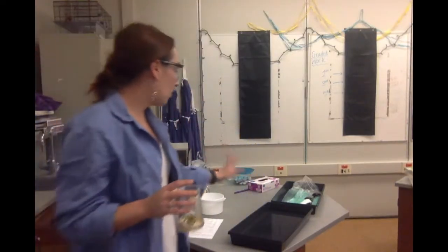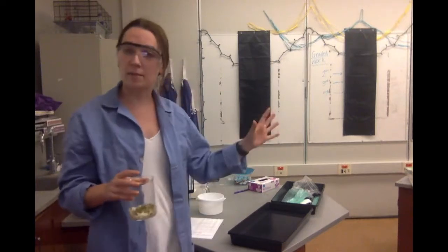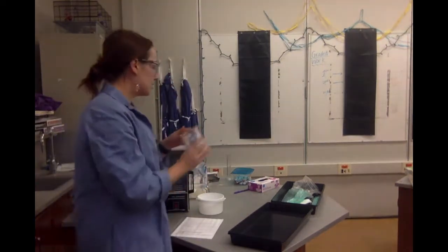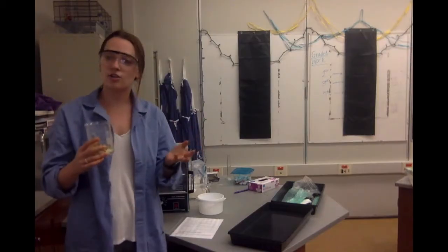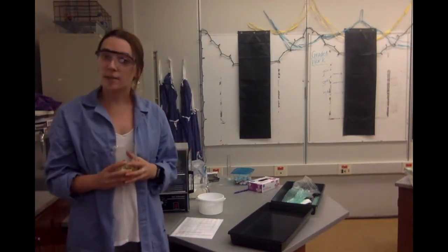I also have a water bath set up at room temperature, and we're going to be using the different seeds — germinating and non-germinating — in our experiment today.